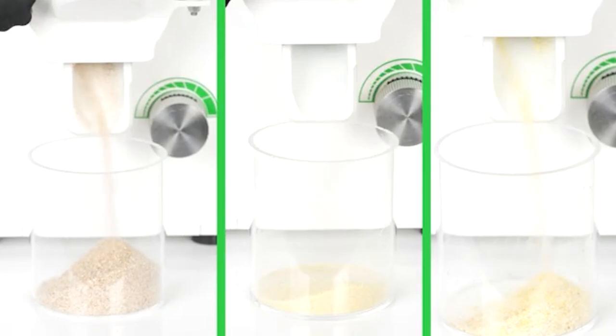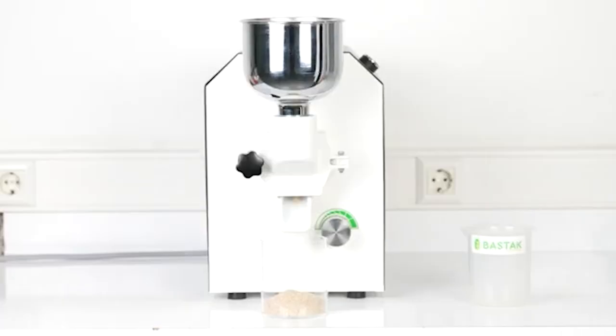After grinding, the sample becomes a product and is collected in the sample collection container through airflow. After the grinding process is completed, press the start/stop button.